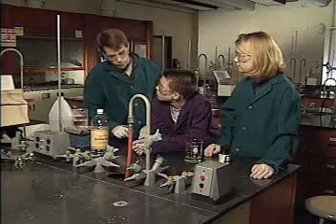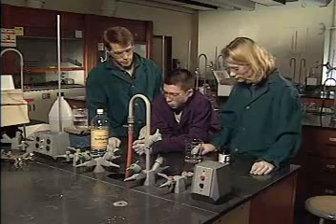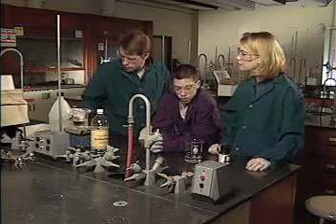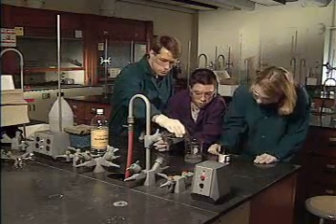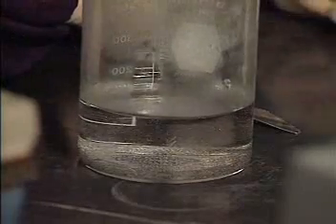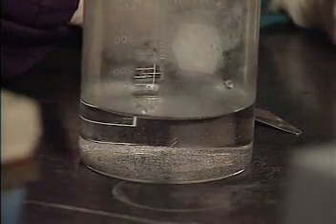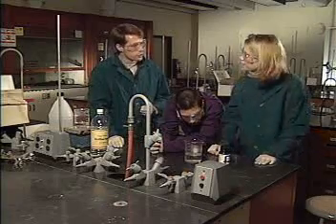We have to be careful here. There might not be enough energy available to get a rapid reaction going. We could add heat from boiling water. Excellent idea. Let's try it. There it goes. I can see bubbles. That's what happens when we increase the available energy. Still a pretty slow reaction, though.